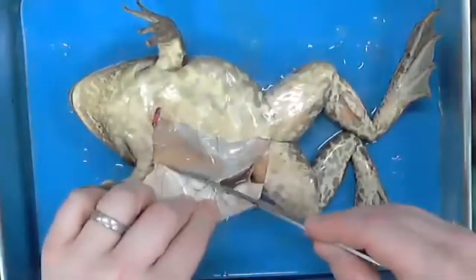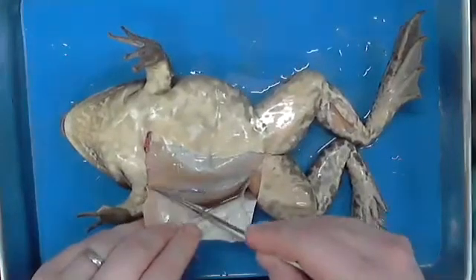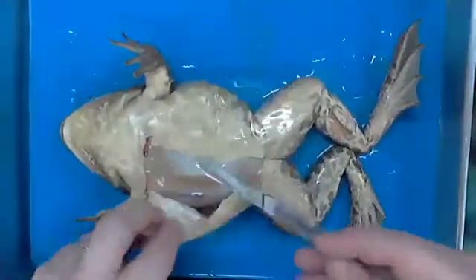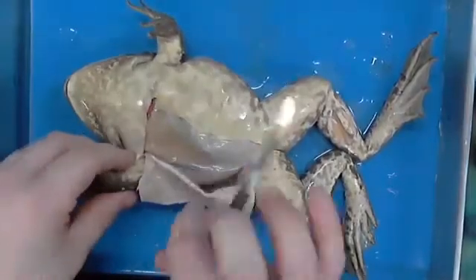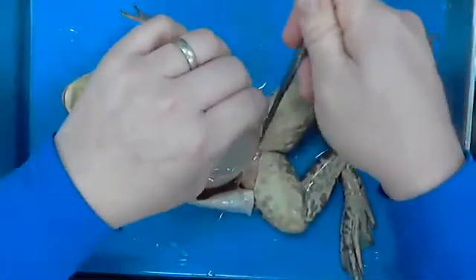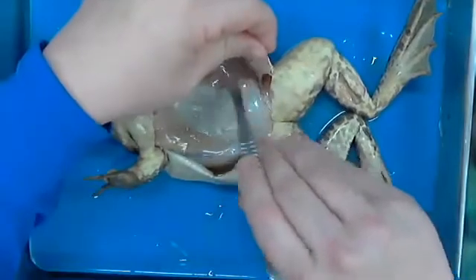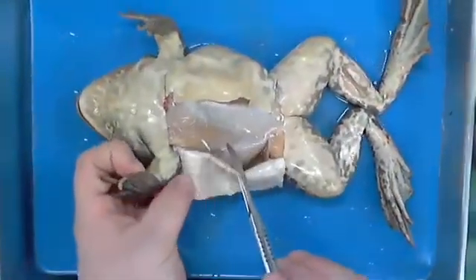I do want you to see, and I'm going to get some stuff out of your way. Just 1 second so that you can kind of take a gander here at some stuff. So notice, I'm going to pin some of this stuff back here in just a second so that it's not bothering you guys as far as being able to see. All right, so I've pretty much kind of taken his underbelly of his coat off. If you notice, we've got some, what are these right here? See if we can see this. I think you should be able to.